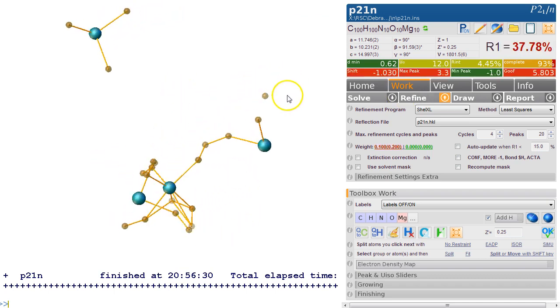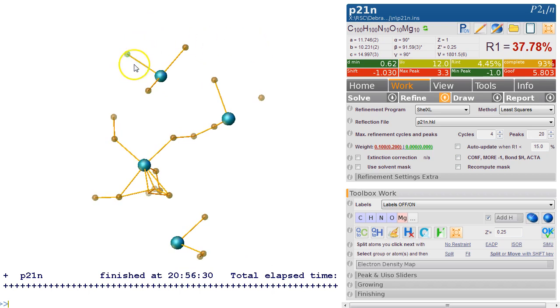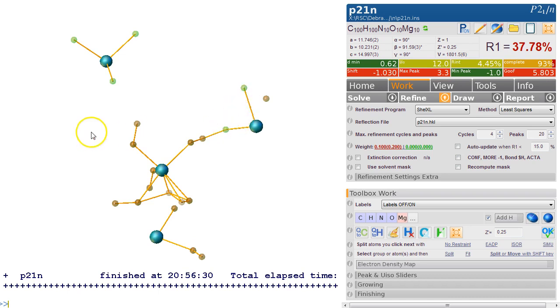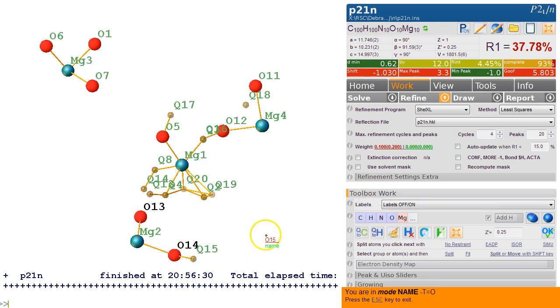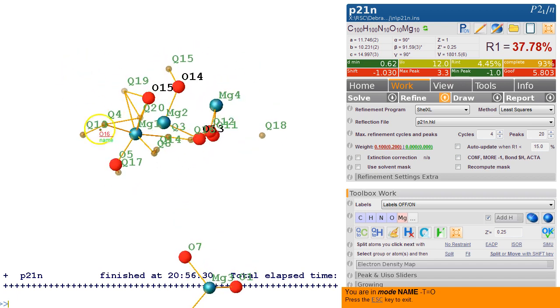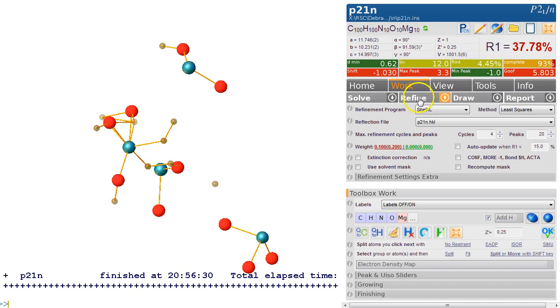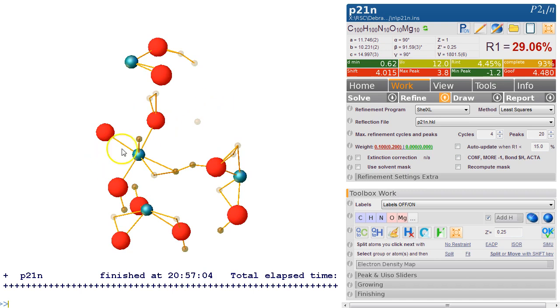So this looks not bad. So we actually got some atoms here and some connectivity. So these ones are probably oxygens if that's magnesium. We select these oxygens here, we select these atoms, and then we make them oxygen. Alternatively, we can pick the oxygen and then click on that and make them oxygen that way, or we just keep going here. Now we've got some atoms in here, we hit escape or click the escape button here and refine. Notice it doesn't really matter that we've missed some out, they'll come out in the wash as it was.